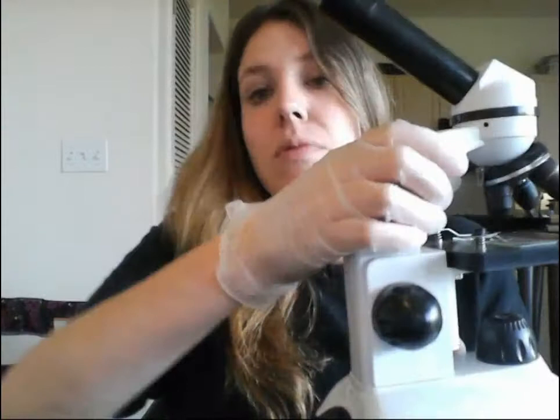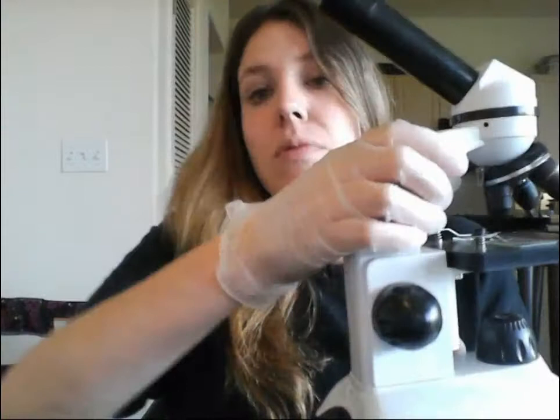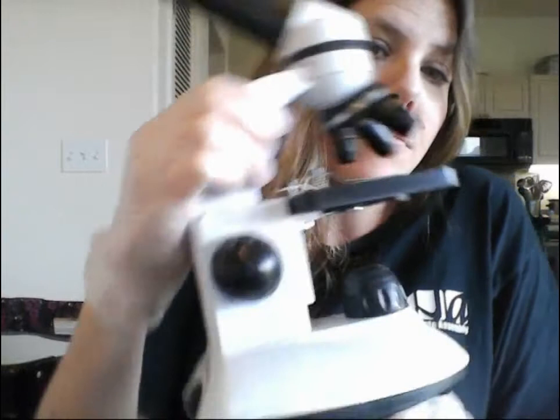This is called the base. When you carry a microscope, you always have one hand on the arm and one hand on the base. This one is really lightweight, but that's how you normally carry a microscope.